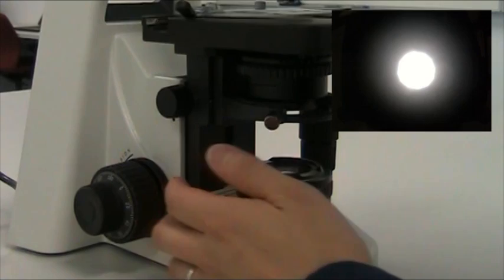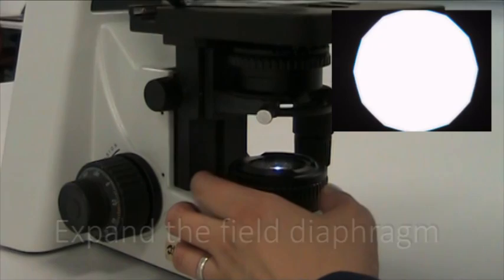Once the edges are sharp, extend the field diaphragm until the aperture of light moves just beyond the field of view.